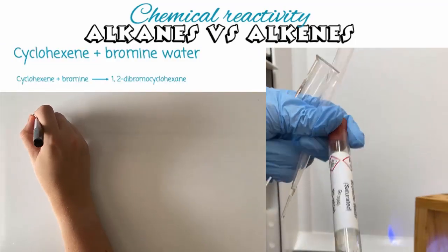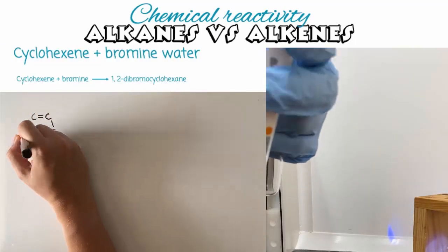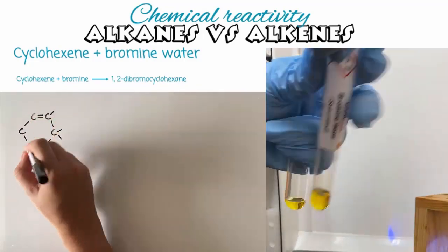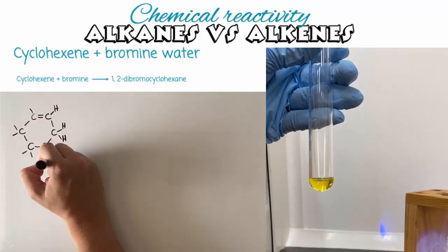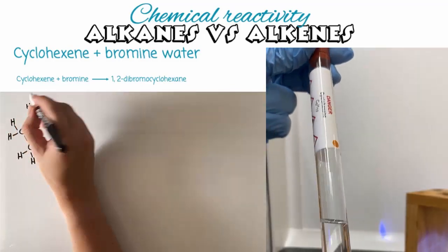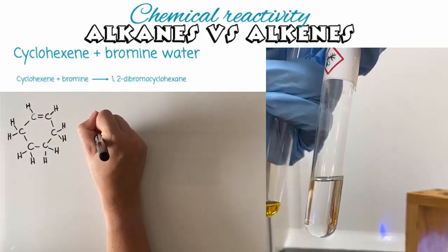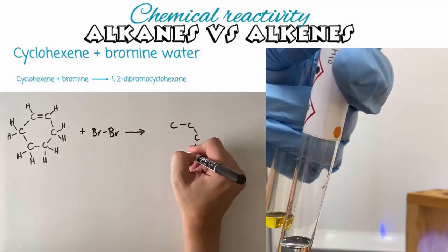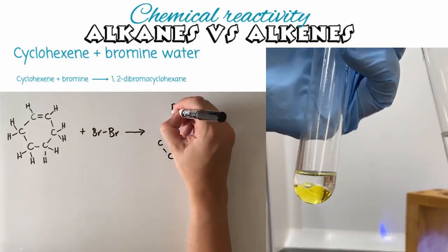When cyclohexene reacts with bromine water the double bond breaks and two bromine atoms are attached to those available bonds. This is called an addition reaction because the bromine atoms are added to the molecule, utilising the broken double bond.